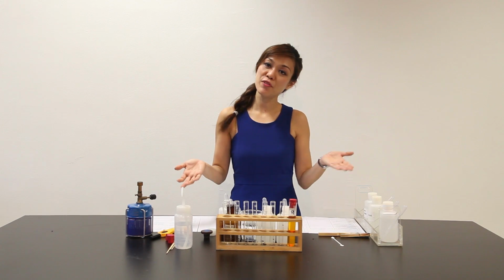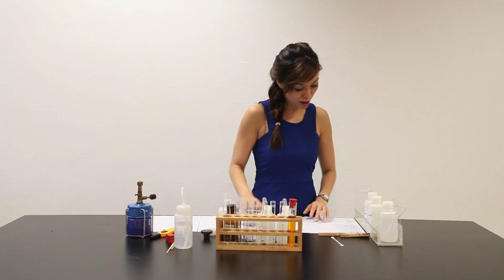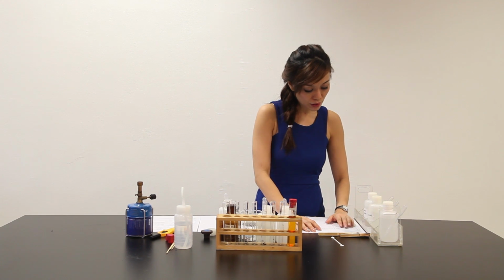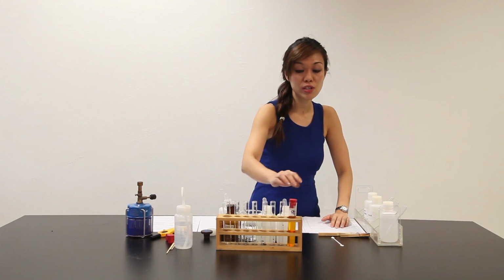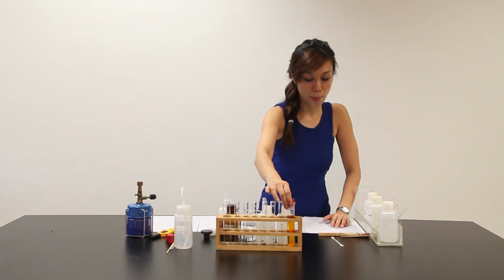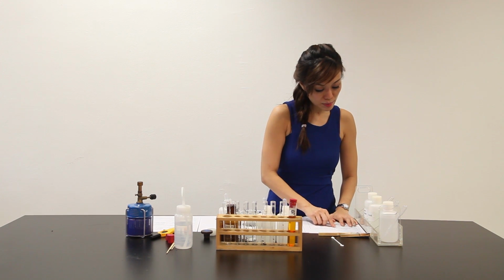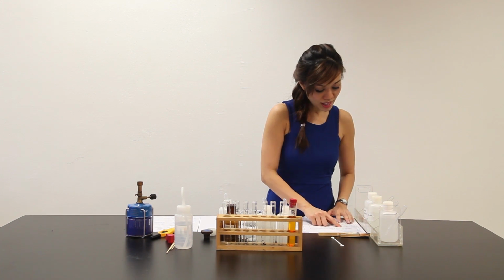As you can see, we have finished preparing. Let's start the execution part. Now, the execution portion here says part A, dissolve the solid salt X in a large test tube, which I've already prepared during the preparation part. And it says add more distilled water until the test tube is about 2/3 full, stopper it, and then I will use this for part B and C.